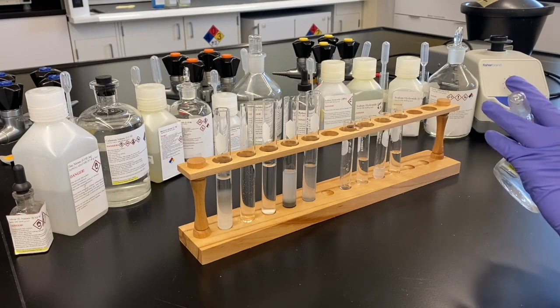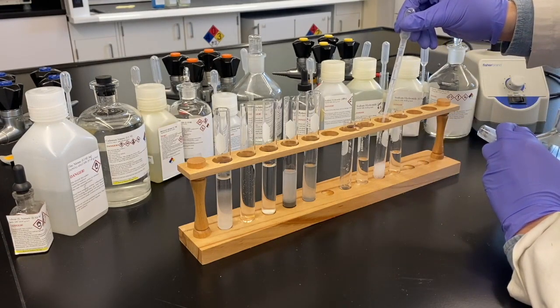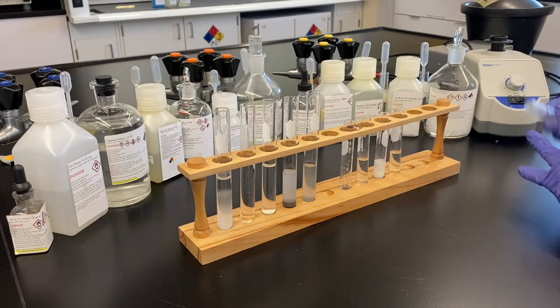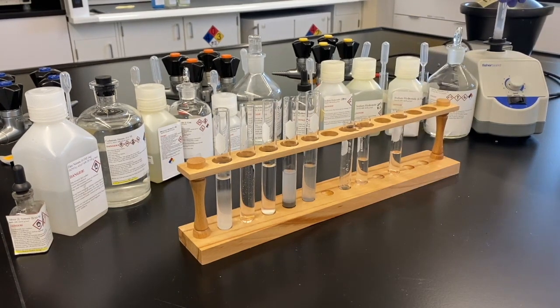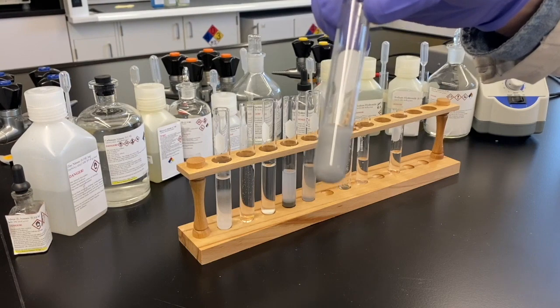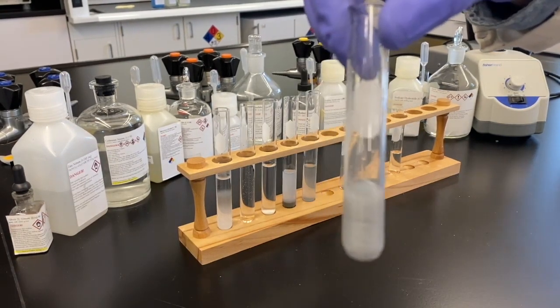So we've redissolved the solid that we had, and we're going to add tin chloride to that to see if we get a new precipitate. It appears we do. Looks like it's changing colors a little bit. It started off white, and now it's making that silvery, the metallic mercury color. Right. Looks like mercury, qualitatively.